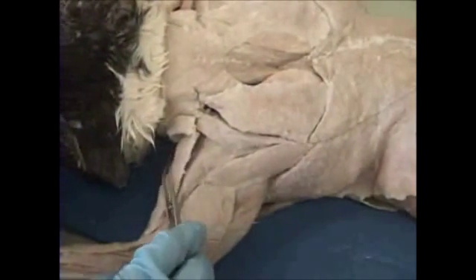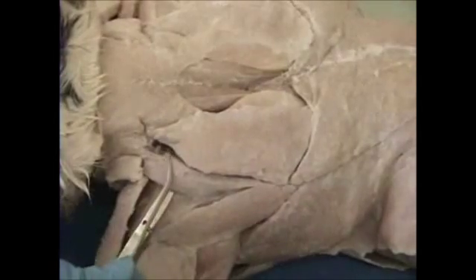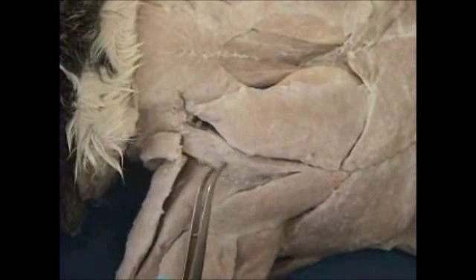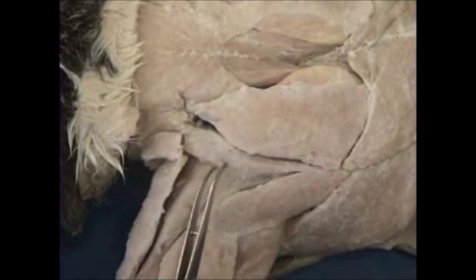Separating your deltoids — clavoacromiospino deltoid — from your clavoacromiospino trapezius, you have this muscle right here known as your levator scapulae ventralis. Note that it has an extra name compared to the human version, which is simply called levator scapulae. In the cat it's the levator scapulae ventralis, and it separates your deltoids from your trapezius.